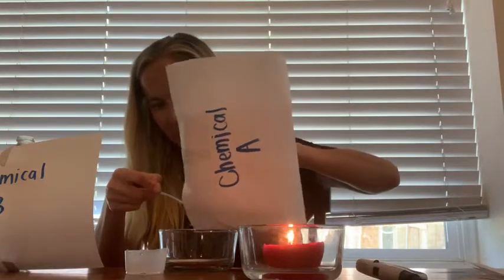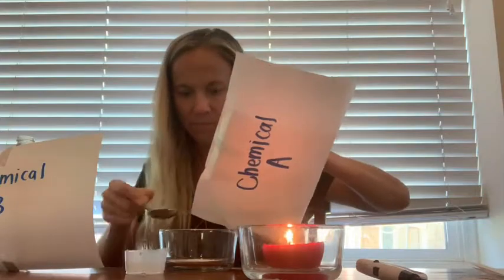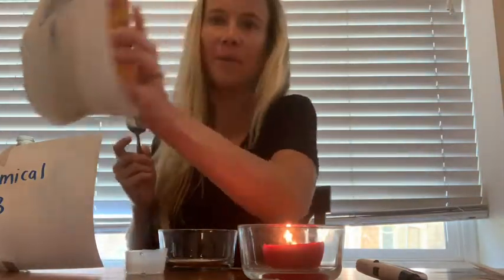Still pouring in chemical A. Okay. So now we have chemical A.